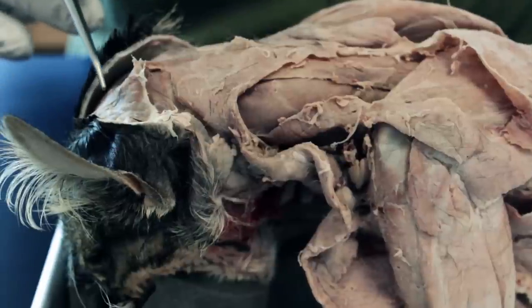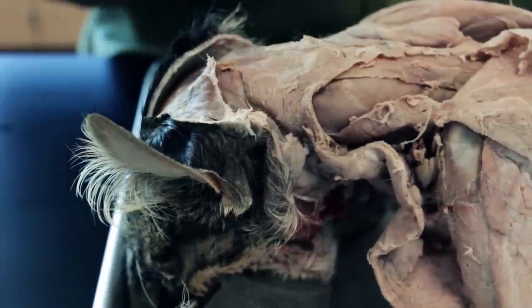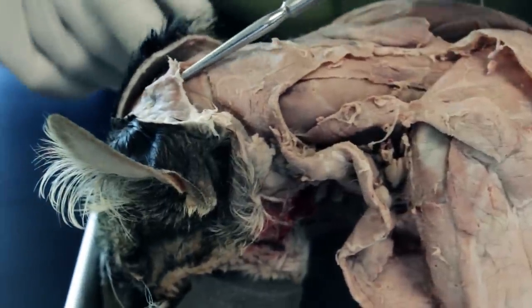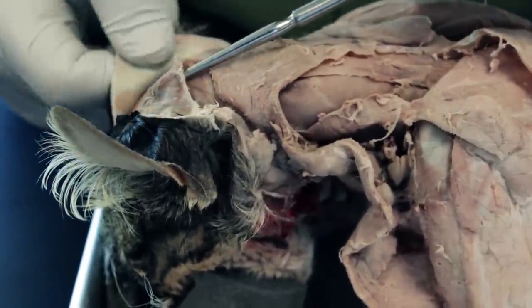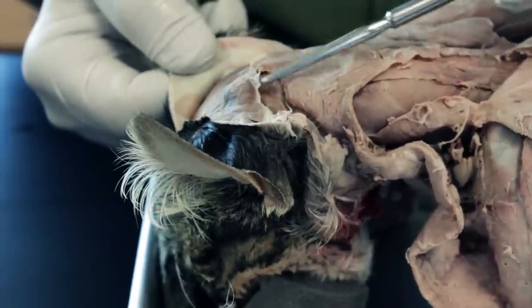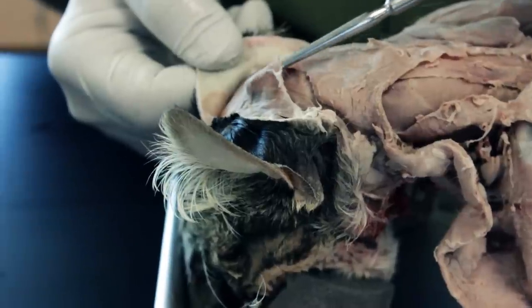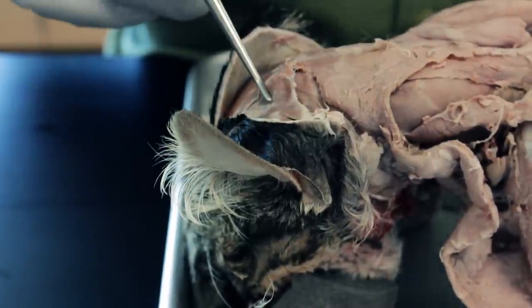We're going to direct our attention to the muscles along the spine of the cat. The first one we're going to look at is over here — this is called the temporalis muscle. Temporalis is, as you can see, on top of the cranium, and you can approach it from either left or right. This is one of the first muscles that we see from the anterior portion of the cat.